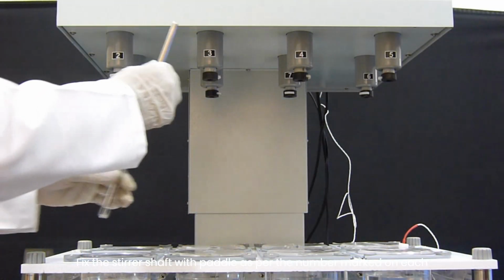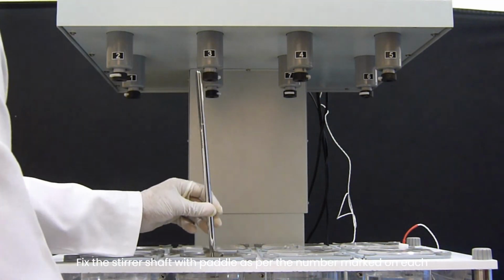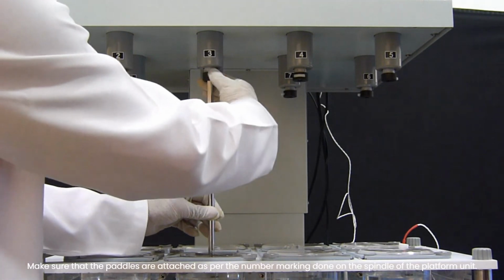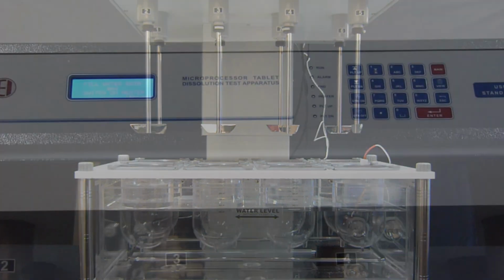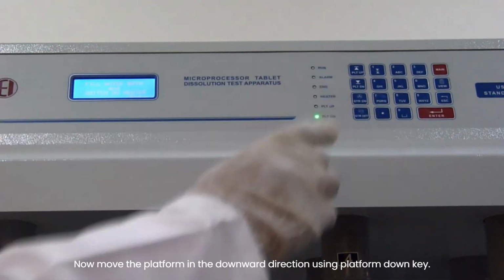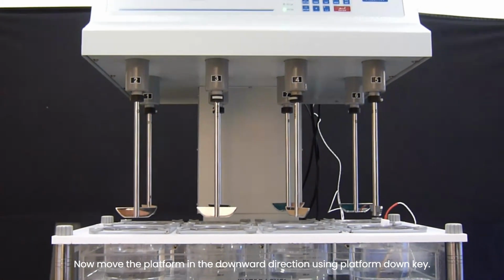Fix the stirrer shaft with paddle as per the number marked on each. Make sure that the paddles are attached as per the number marking done on the spindle of the platform unit. Now move the platform in the downward direction using platform down key.